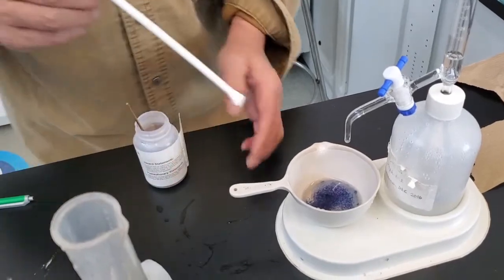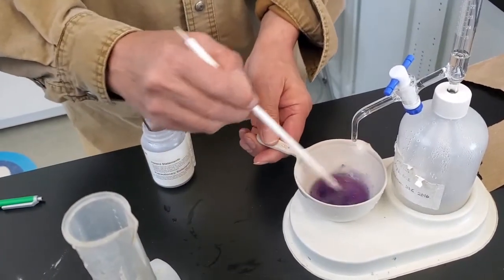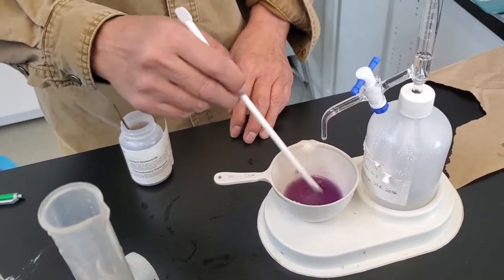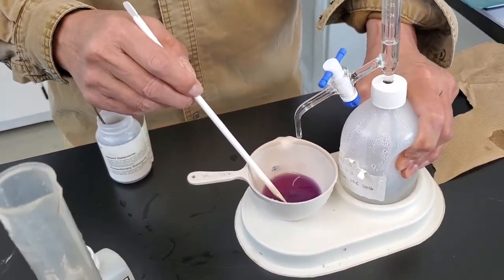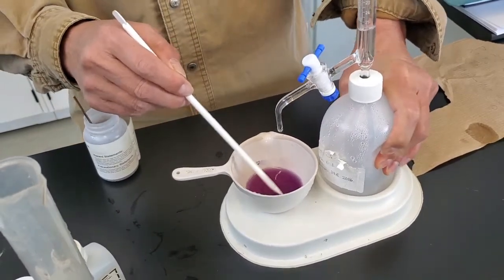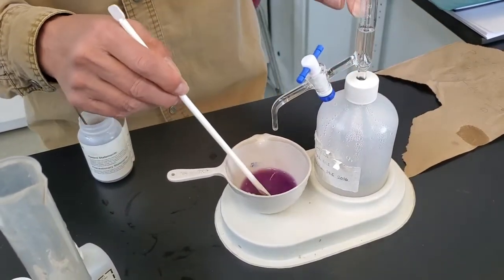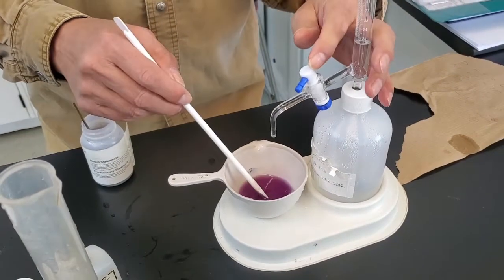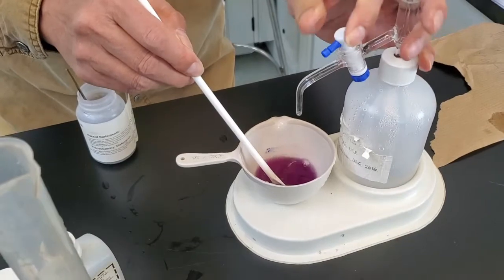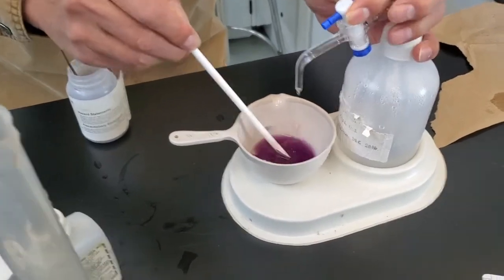Now, I stir it. Now, so it turns a little pink. That means there is some hardness. Hardness exists. Now, we don't have too much of this, but I just show you the color. You try to titrate this. Try to titrate this. See the color change.